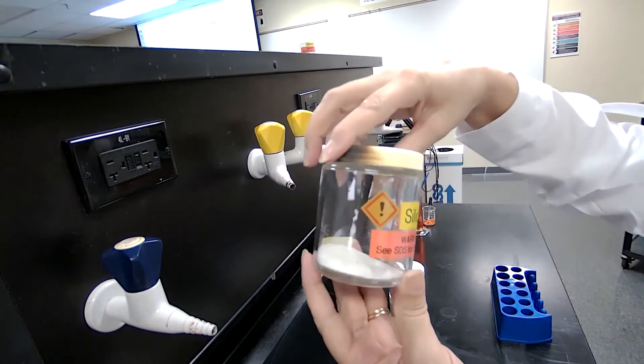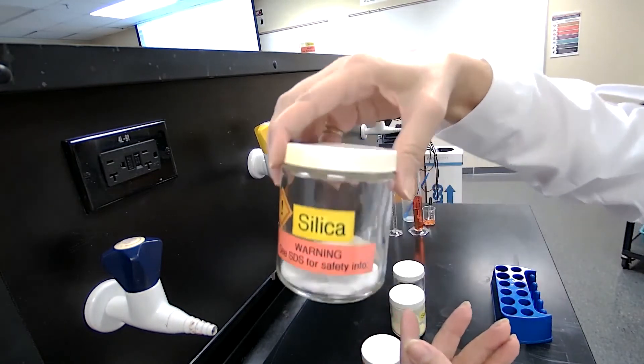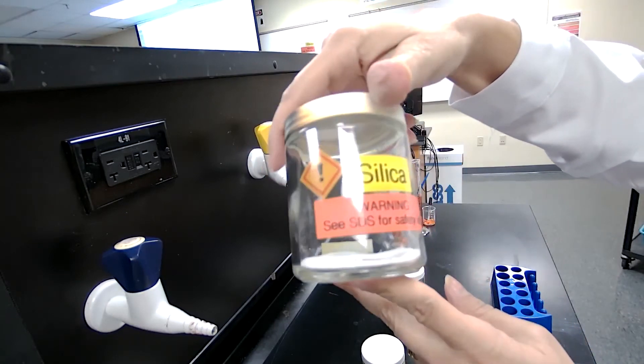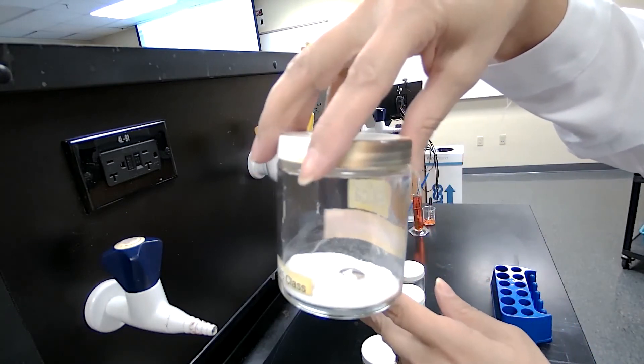Next element is silica. So we have the powder of silica. Record your observation.